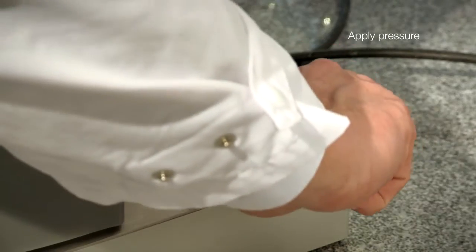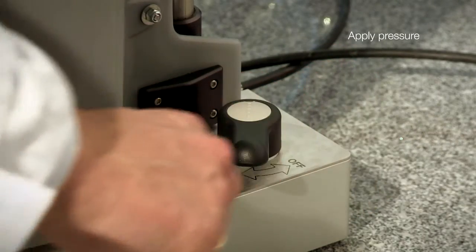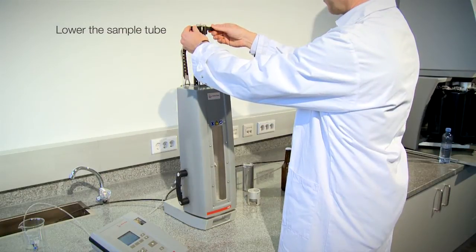Like before, apply pressure for piercing. Then lower the sample tube.